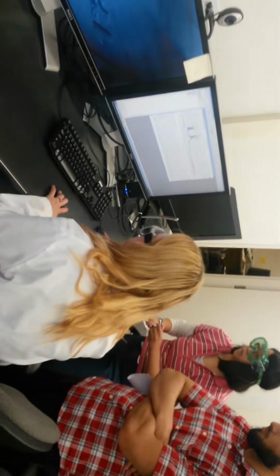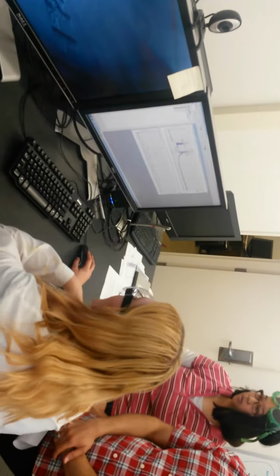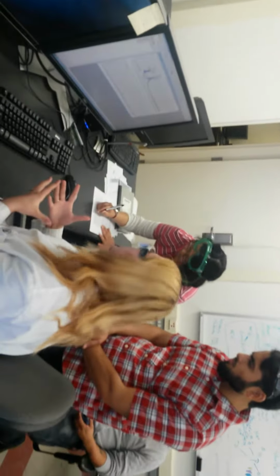But you have to go based off of what your HPLC graph told you. So your HPLC graph told you that it eluted out at 4.6. Now you need to give 0.1 to 0.5 seconds for the MS to pick up what the HPLC was saying. So instead of going over here to 3, you need to go past 4.6 in order to read your caffeine. So whatever your elution time is, you need to go past that to find where your peak of actual sample is. I have a question.